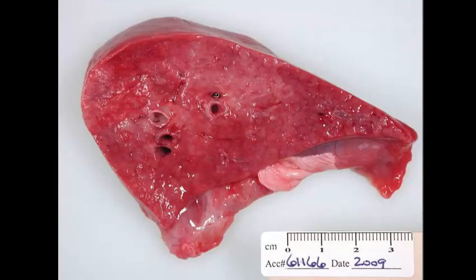Okay, here is slide number 9, and this is tissue from a goat. I'd like a morphologic diagnosis, the cause, and name 2 other possible lesions in this animal. Give yourself 90 seconds for this somewhat convoluted question.